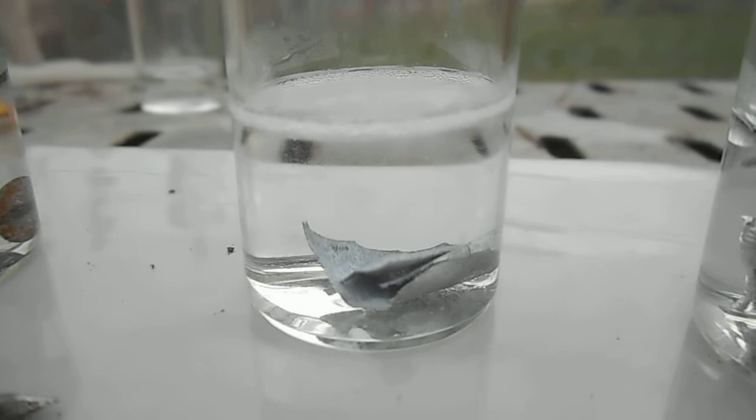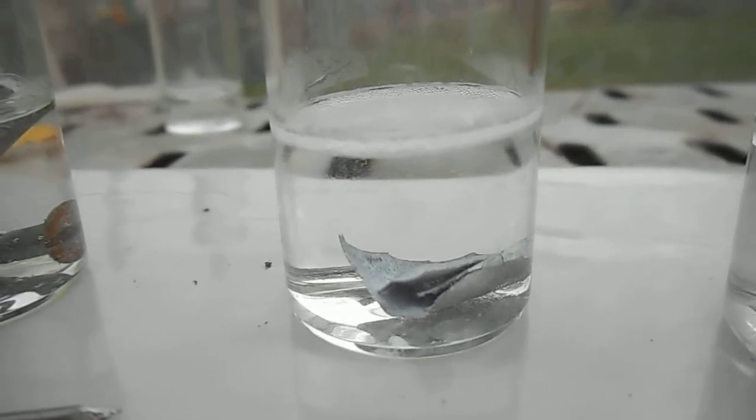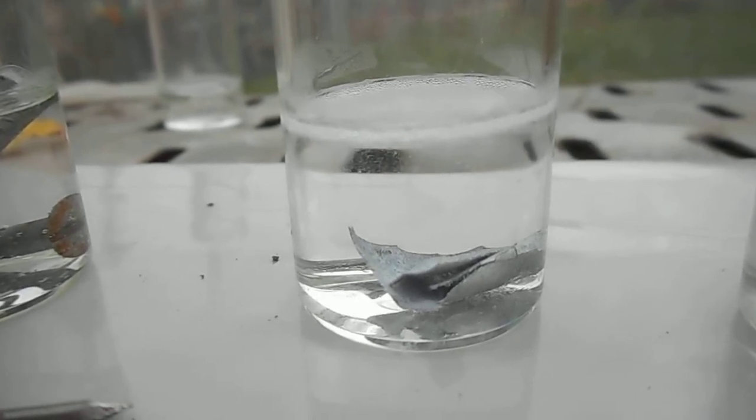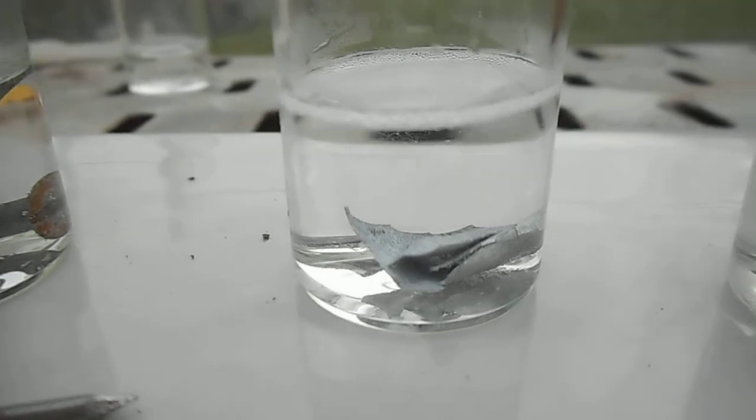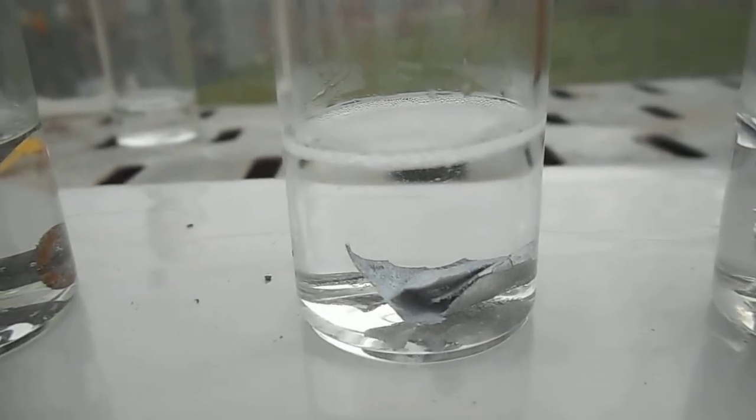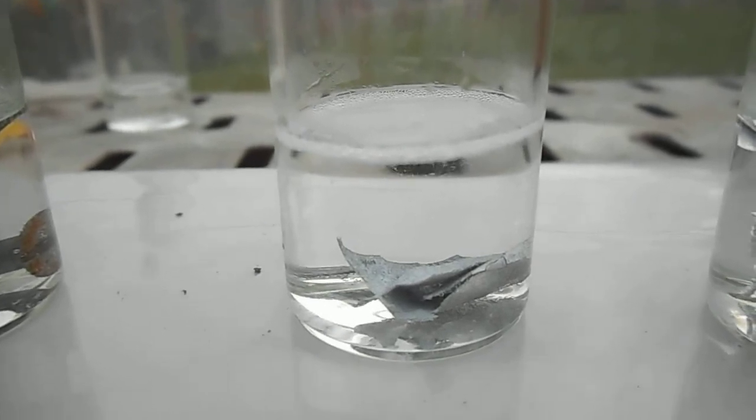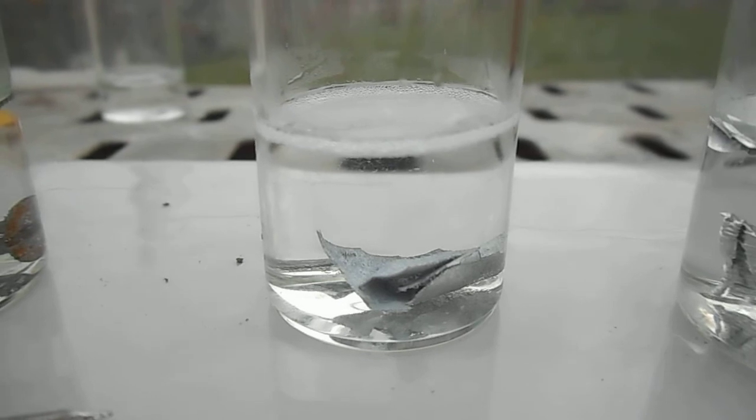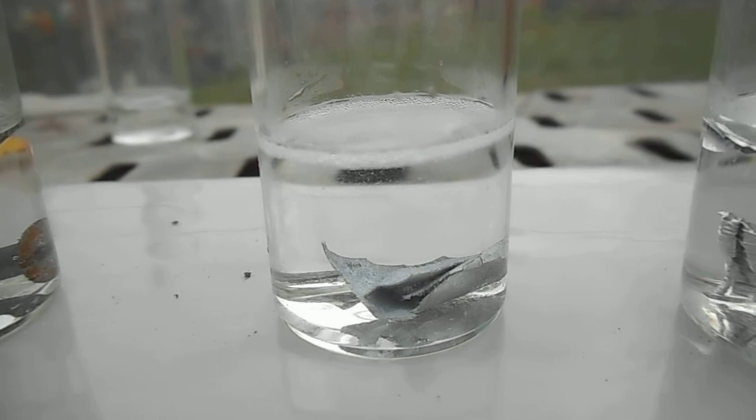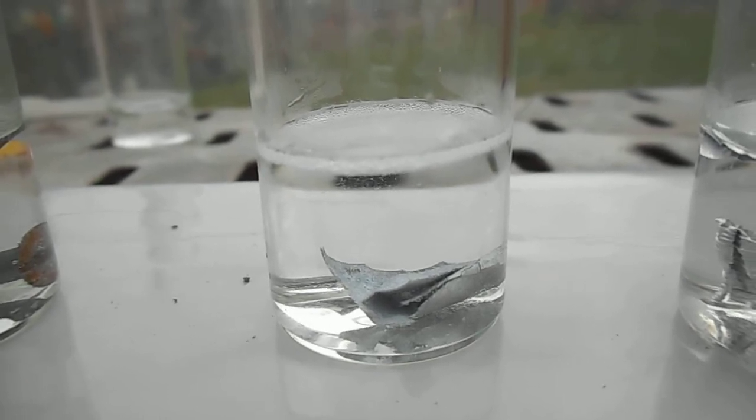Here's the zinc. Now there are some bubbles on the surface of the liquid there, and you should be able to see a very slow formation of bubbles from the zinc. So that reaction not really speeded up with time. Just a very slow reaction going on there.